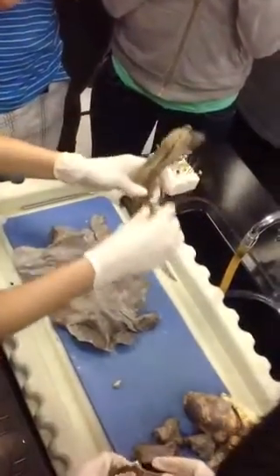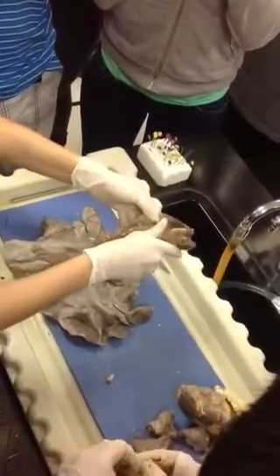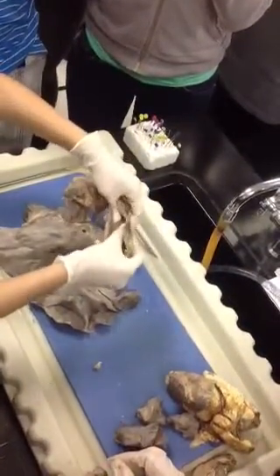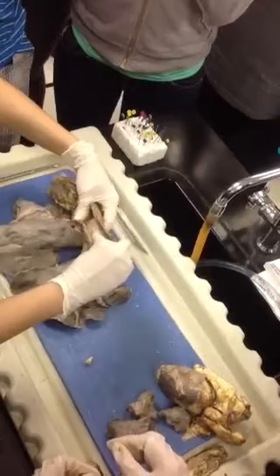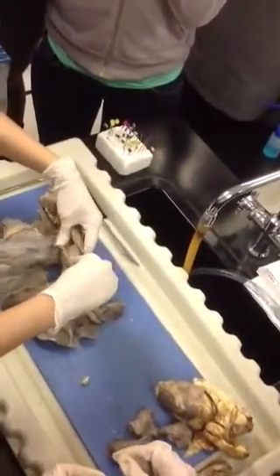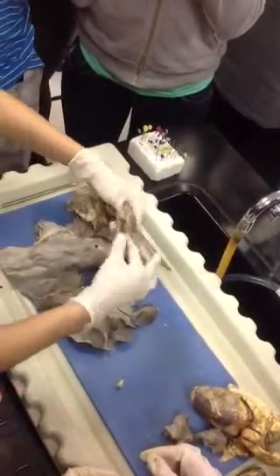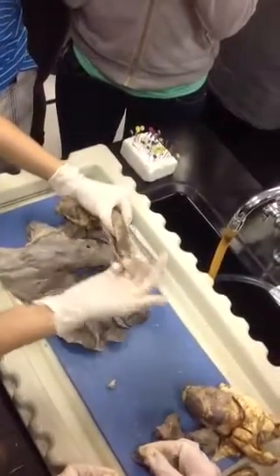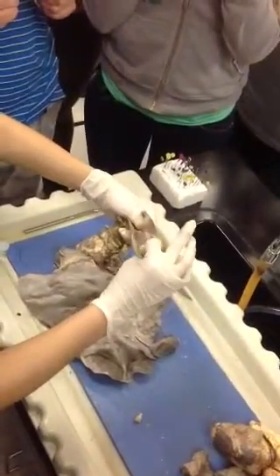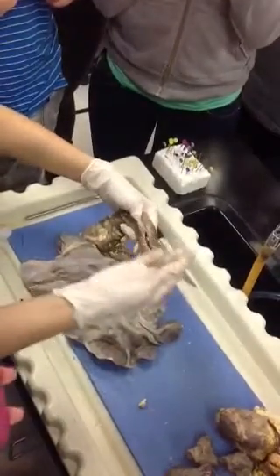Now with the trachea, remember histologically, we can identify the different types of tissue and epithelial lining. So what type of tissue would be towards the lumen? Ciliated columnar epithelial tissue. Pseudostratified ciliated columnar ET. Good. All right, so that means that it has cilia. So if you take a glove and rub it against the lumen, you can feel a velvet-like feel to it because the cilia is catching onto your glove.